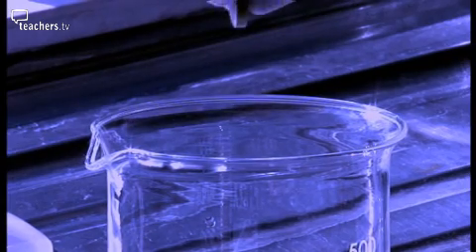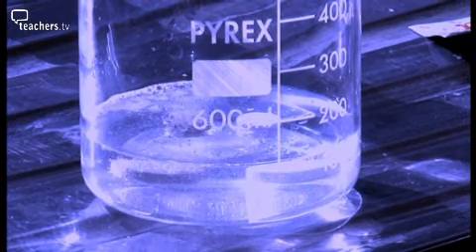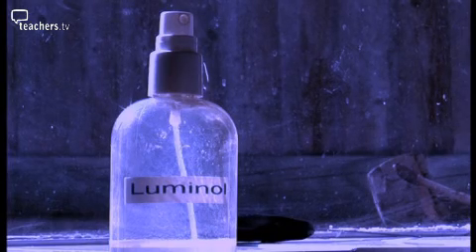We also have another tool in our chemistry box. It's a technique using a chemical called Luminol. Now this is highly sensitive. Luminol is just a chemical called luminol and hydrogen peroxide. So the same way that Kastle Meyer has hydrogen peroxide in it, phenolphthalein, luminol is luminol and hydrogen peroxide.